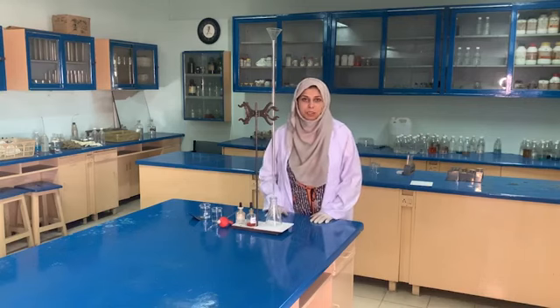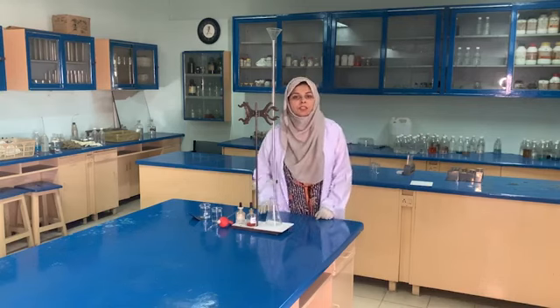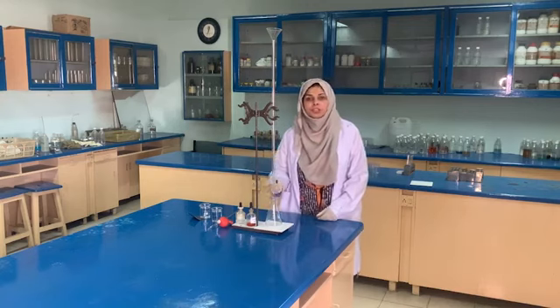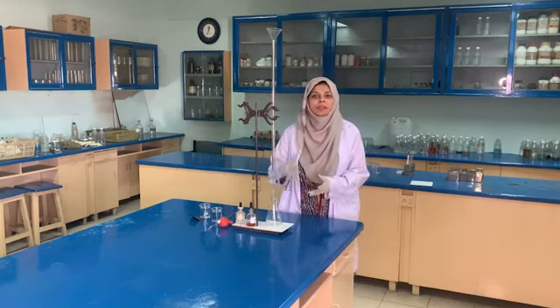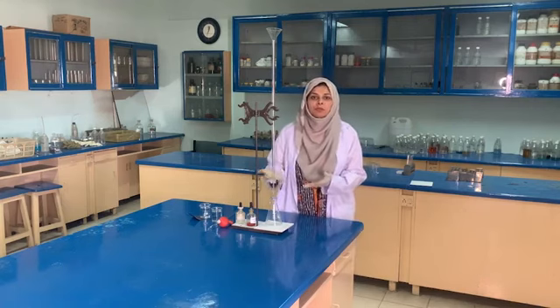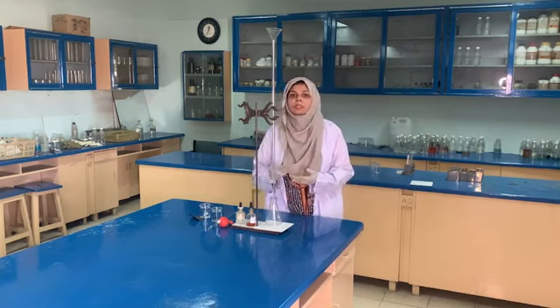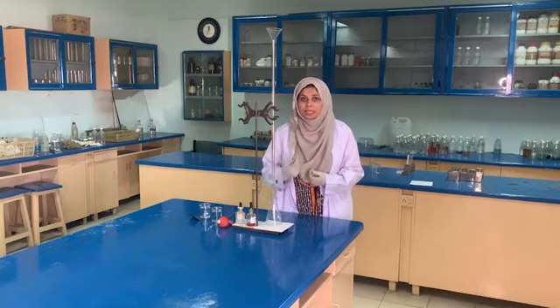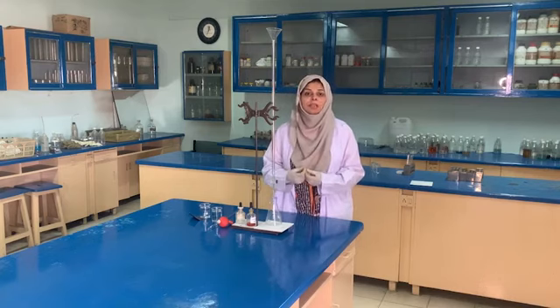Today we are going to start a lecture on titration. So this is the acid base titration through which we can identify the percentage purity, the percentage composition of the substance, and we can get the Mr or Ar, the number of moles or mass of the respective substances. It depends upon the experiment what we are going to find out. But the basics in all the titration experiments are the same. So now we are going to start the experiment.